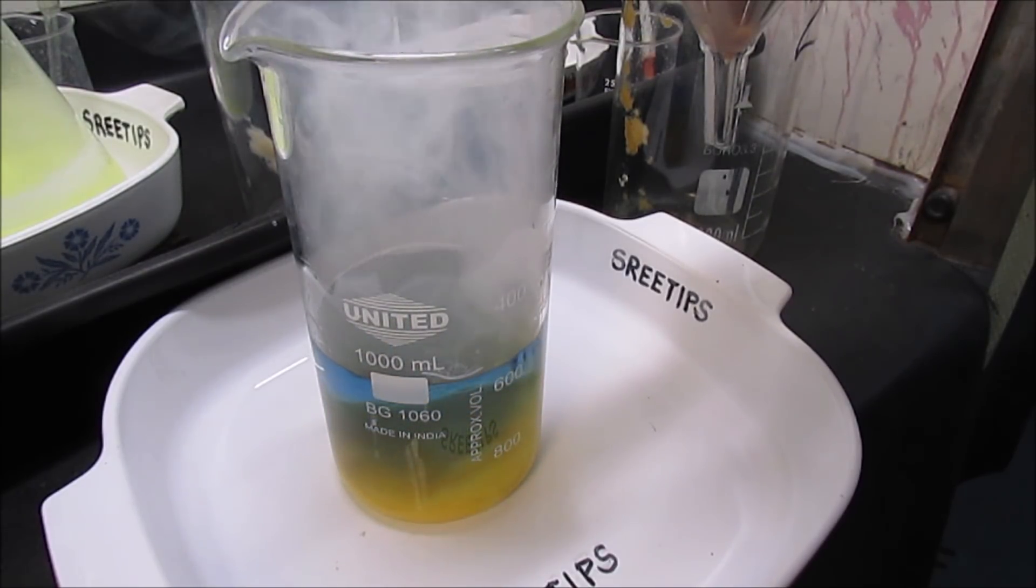That real pretty yellow. There it goes. There it goes. Look at that, man. Very nice. Man, who gets to do this? This is awesome.